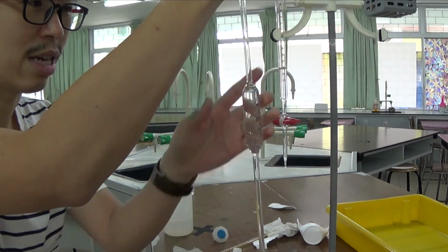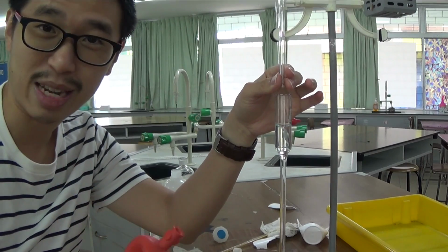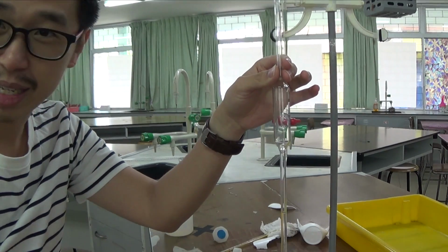It's not like the normal titration where you are supposed to get similar kind of titer. This is a different kind of titration. This is called thermometric titration. You don't know what the endpoint is going to be because you're going to use the data to plot the graph where they intersect later on.